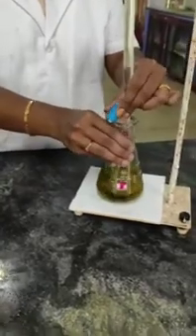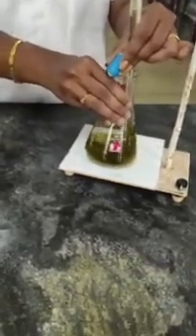Now transfer the solution into a clean conical flask and titrate the excess dichromate with standard 0.1 normal ferrous ammonium sulphate using ferroin indicator. The colour change from blue-green to reddish brown indicates the end point.